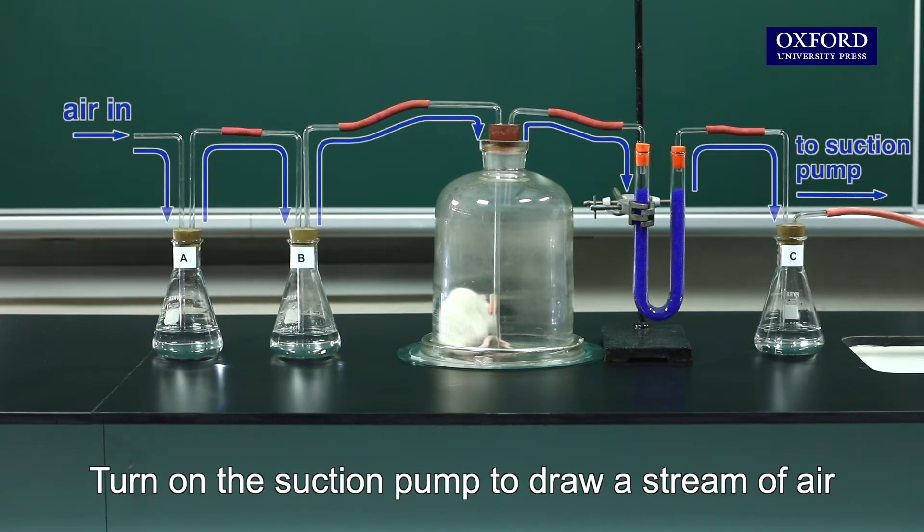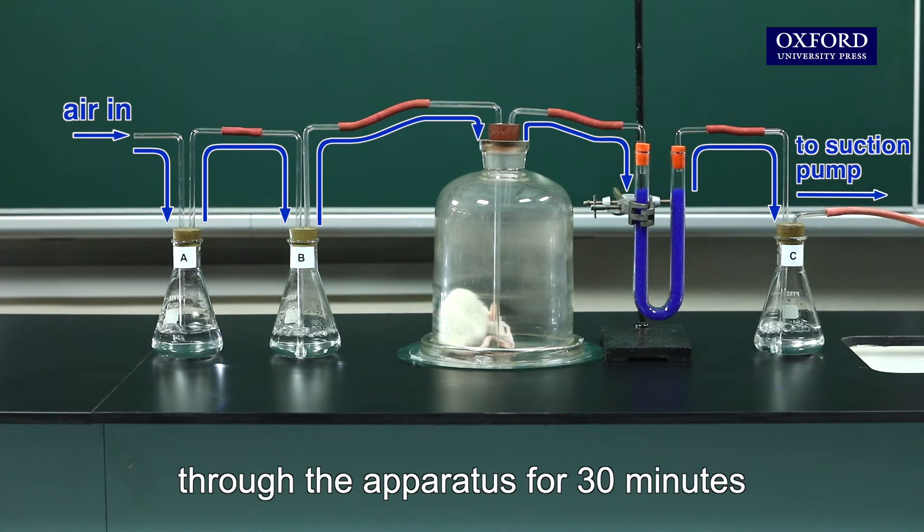Turn on the suction pump to draw a stream of air through the apparatus for 30 minutes.